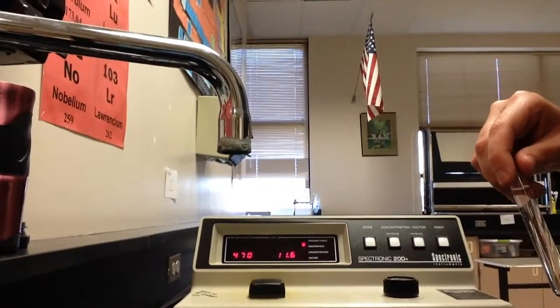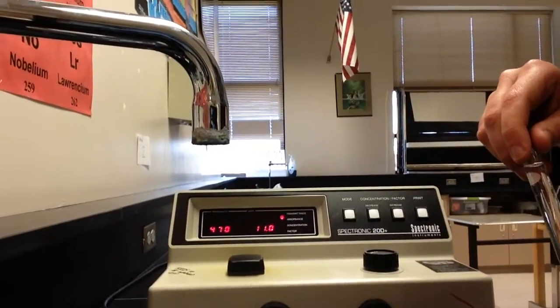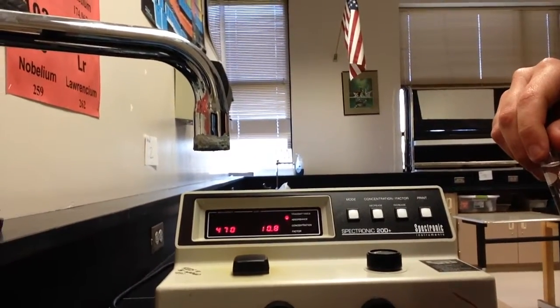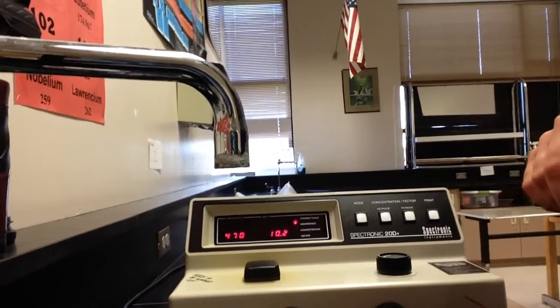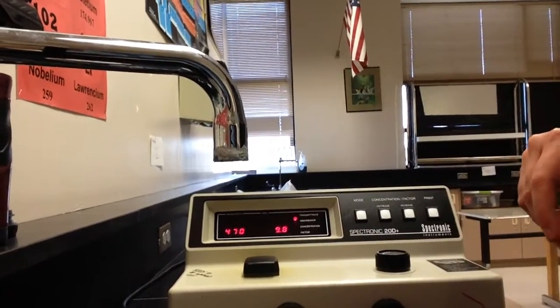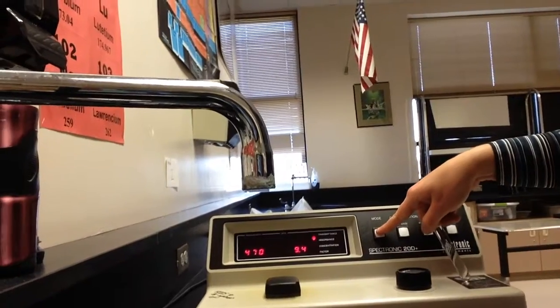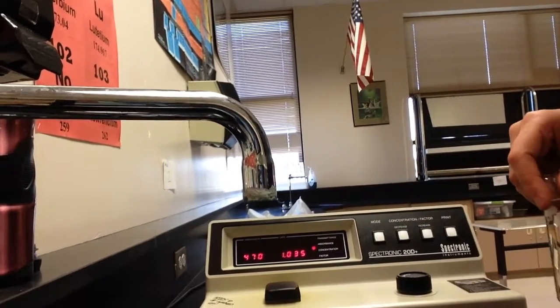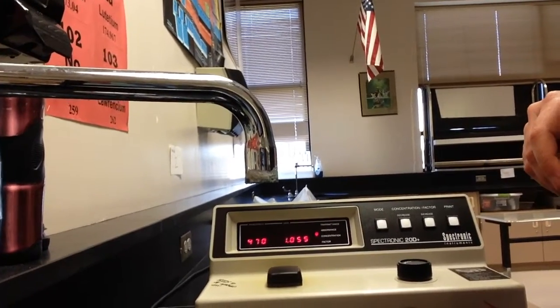The only other thing I need to tell you is that guaiacol cannot go down the sink, so I'll have a special waste container for the guaiacol, and then we have the district dispose of that in a safe way. Oh, and I just realized that I did something really atrocious. Don't do this. I'm supposed to be on absorbance, and right now I'm on transmittance. If you switch over to absorbance, you're able to see these numbers as they change, and you can record that value.